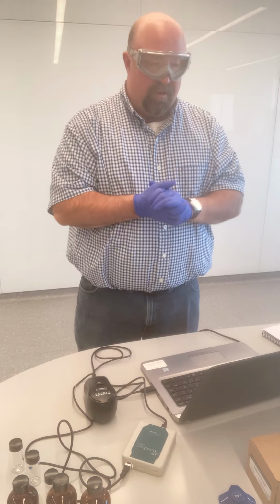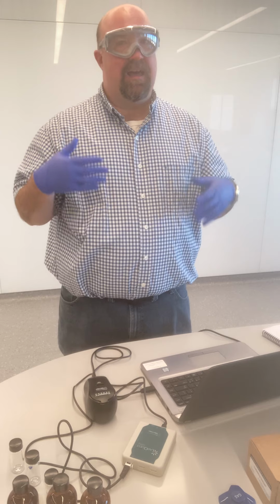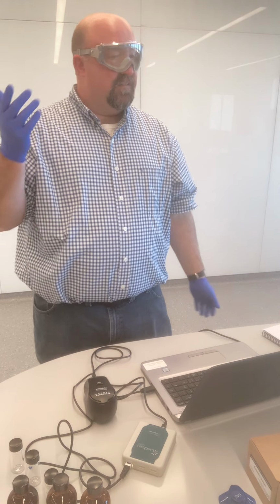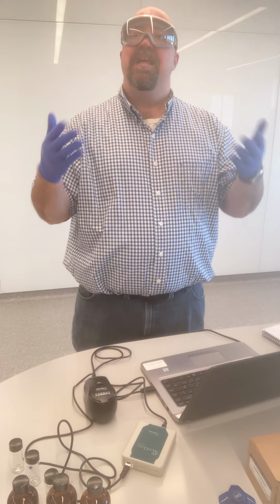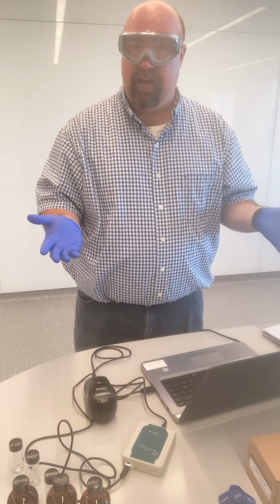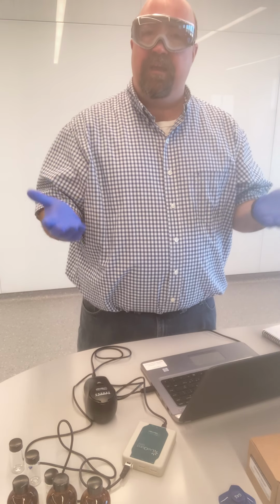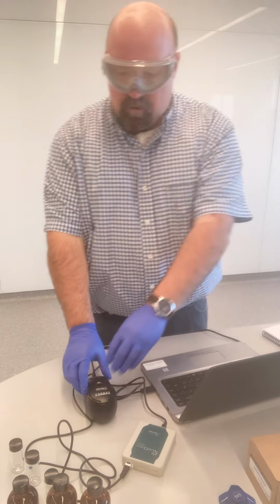And again, this was discussed in pre-lab, but if you're getting percent RSDs of 6%, 10%, 12%, somewhere like that, that's a good, fairly precise data set. We start getting percent RSDs of 30, 50, 100%, something like that. That's when we need to start thinking about how well we can actually trust our data. And so that's why we're taking triplicate measurements. So you're then able to think about the reproducibility of your data, to think about how precise my data set is. And so let's keep going.